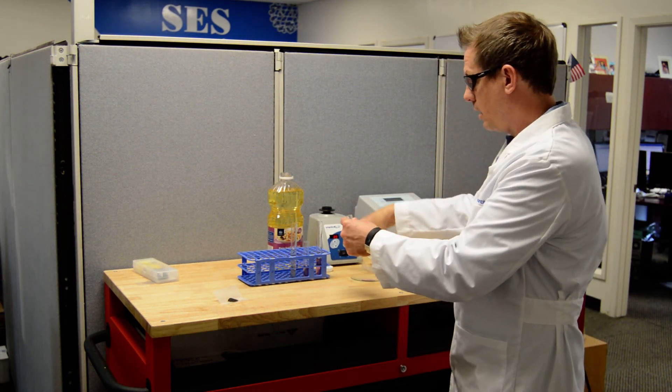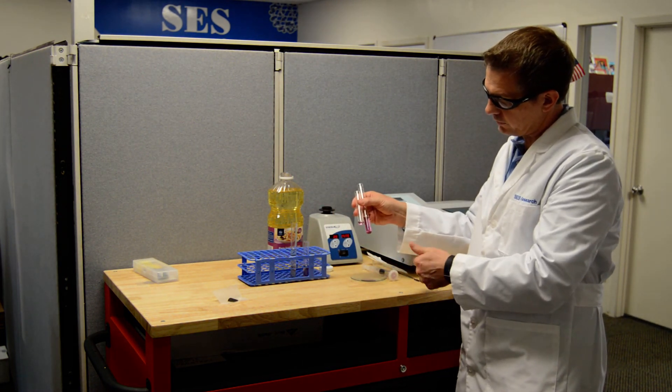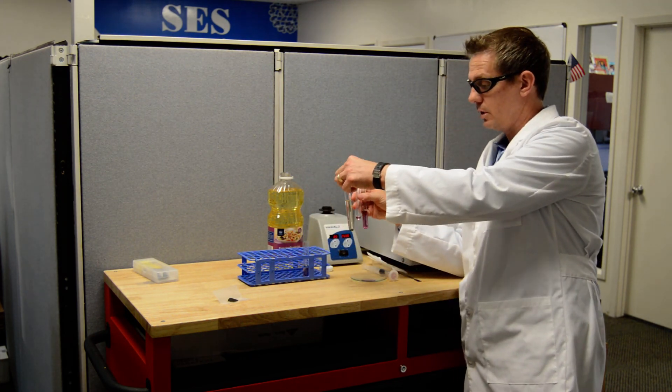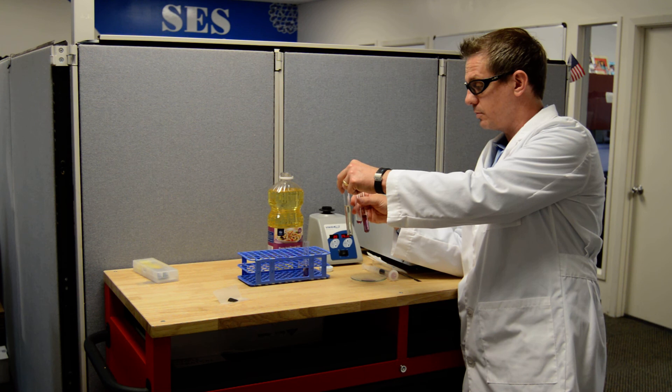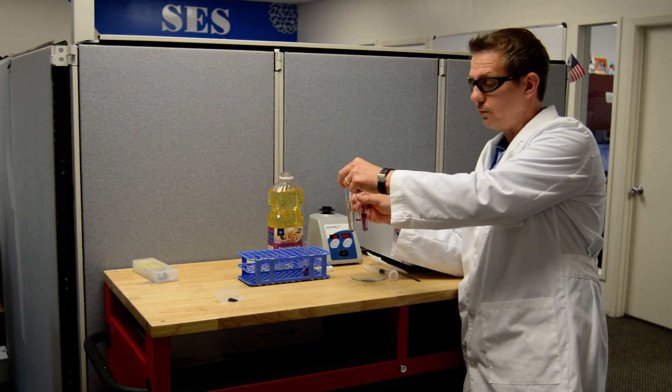So if you look, here's the original solution. Here's the solution after filtering. It's probably going to look a little lighter on the camera just because there's not as much of the solution and then here's sunflower seed oil with C-60 and obviously the C-60 hasn't dissolved yet.